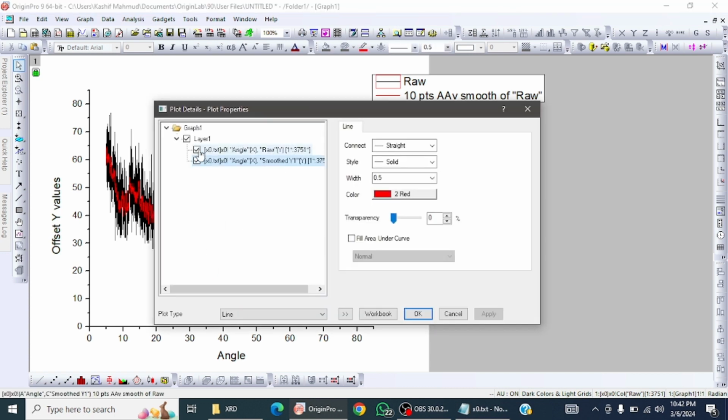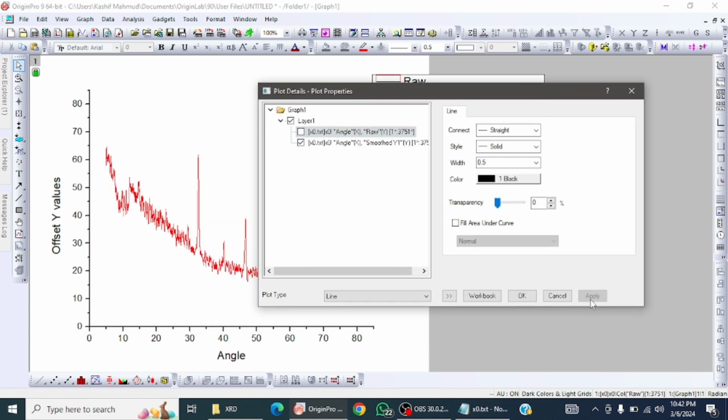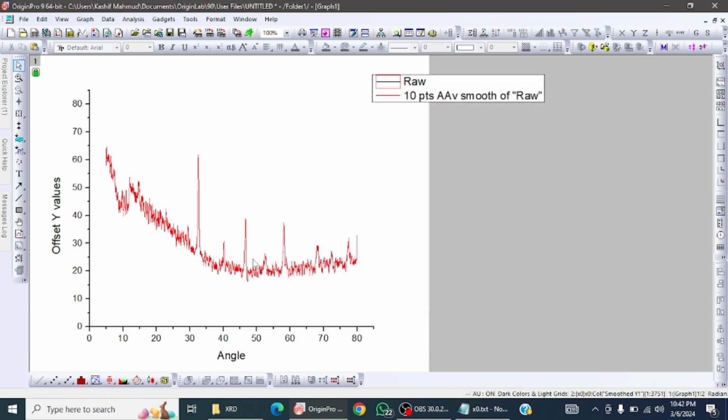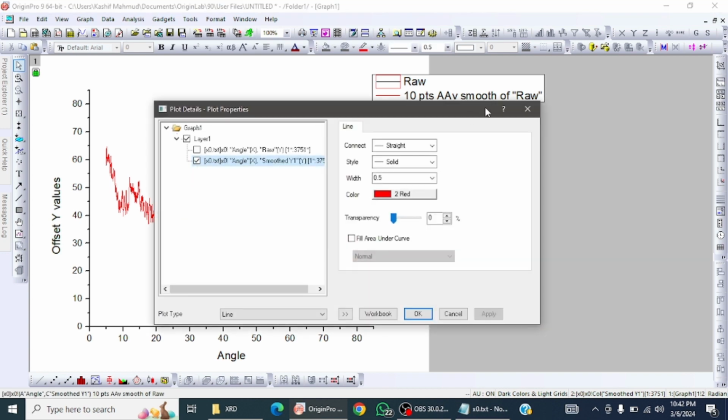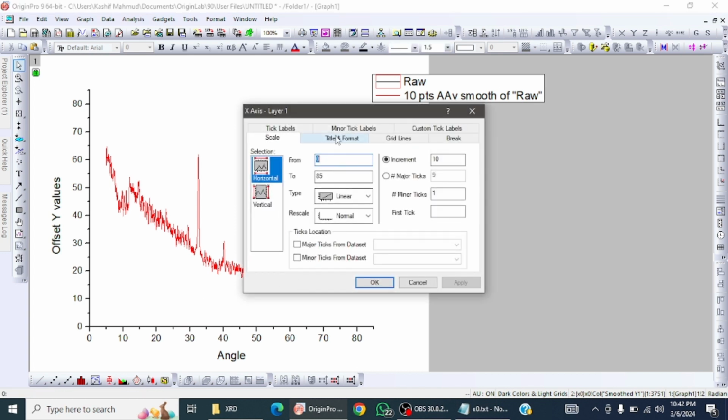So click on it and deselect it. Look at this, apply and okay. So you see this is the way how to remove noise from a single data set, and rearrange this.